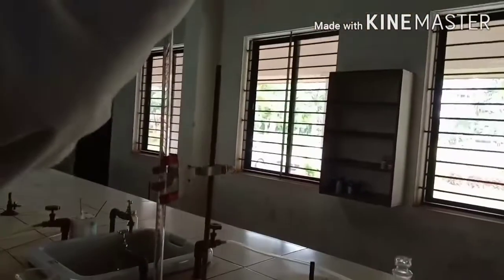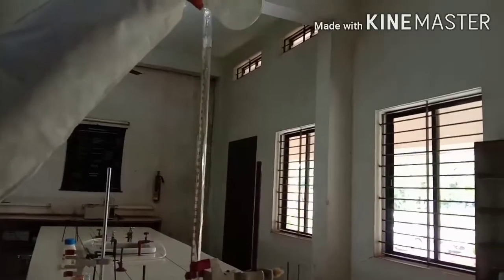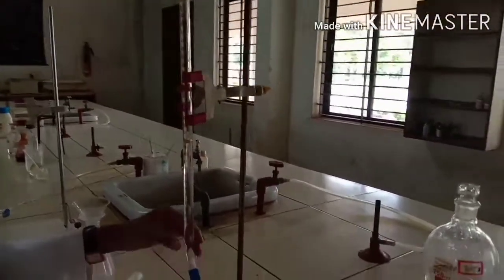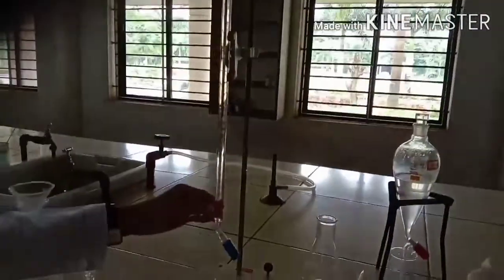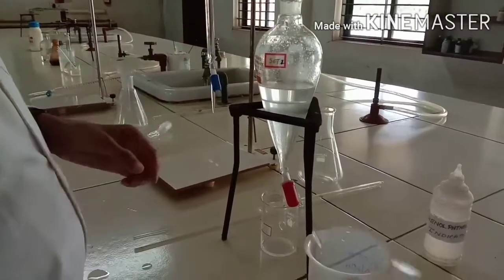Transfer 0.05 normal sodium hydroxide solution into a burette for titrating the aqueous layer. Fill the burette carefully and adjust the reading to zero. This burette is for titrating the aqueous layer.